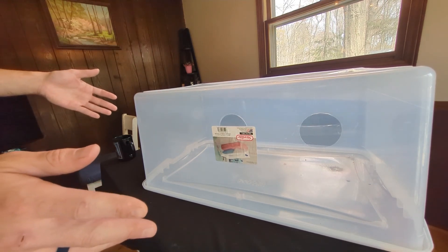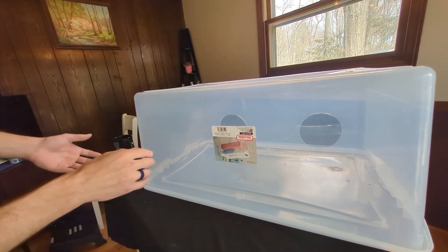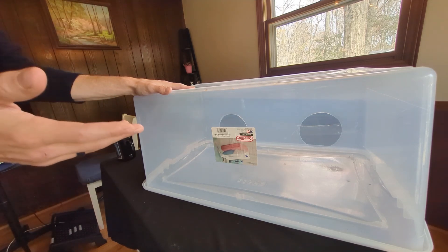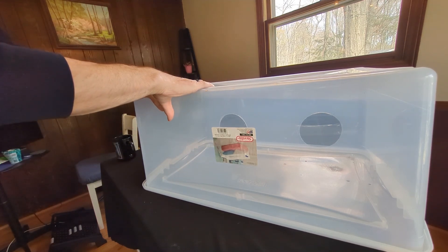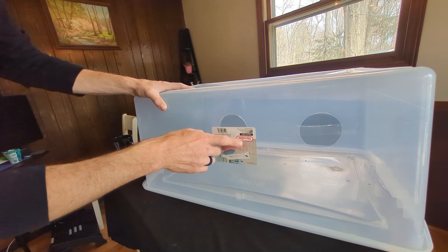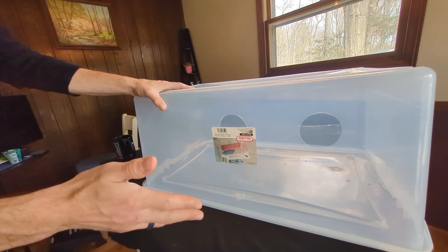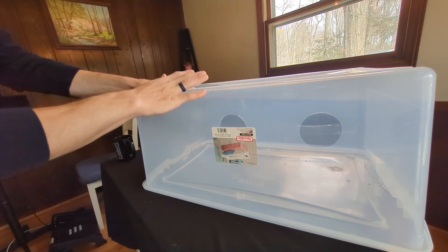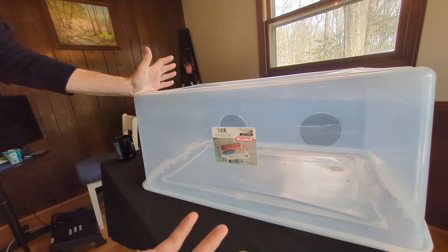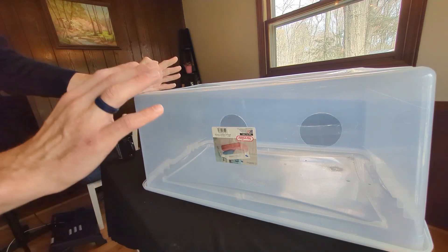The first thing you're going to need is a big tote, a big plastic container. Just to give you an idea of the size, this is a 105-quart or 99-liter container. This is a Sterilite container — that's the brand. If you can get an off-brand, just fine, get whatever's cheapest. But Sterilite does make great containers; they're sturdy and they work well. The size is 105 quart, 99 liter. I got the biggest one I could find — I wish I could have found one a little bit bigger. I know a lot of people work in boxes even smaller than this. It's nice to have more workspace, but keep in mind that's going to be more area that you have to clean.